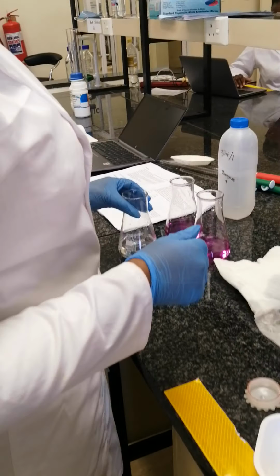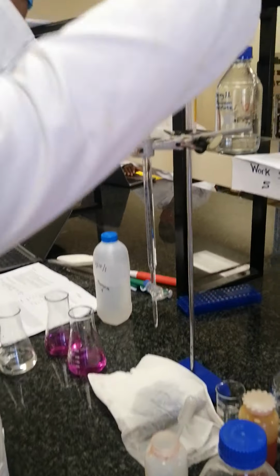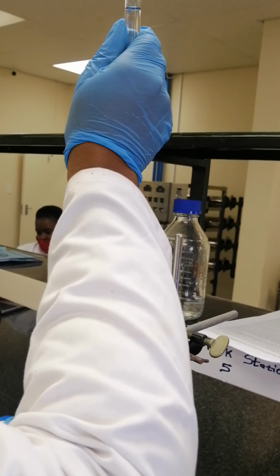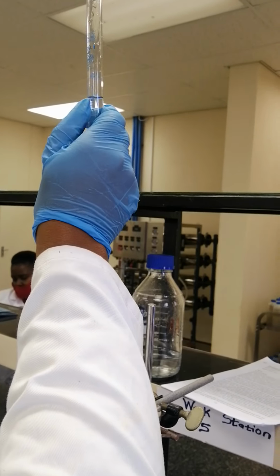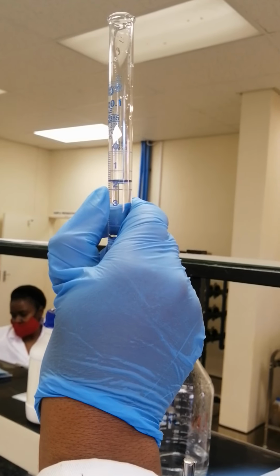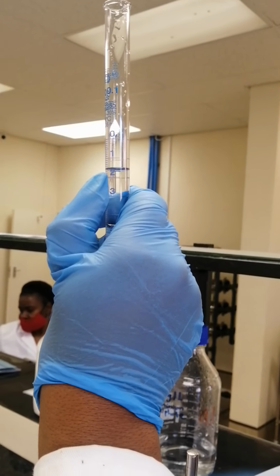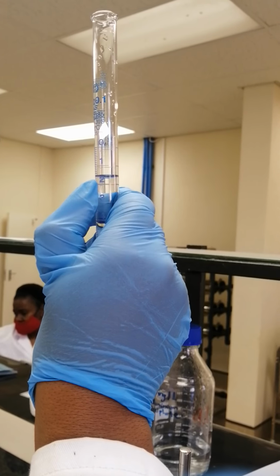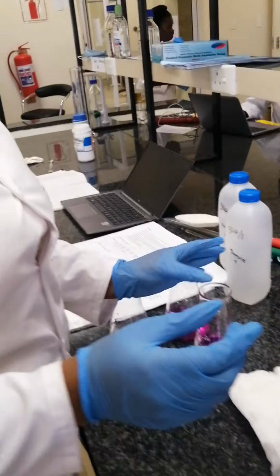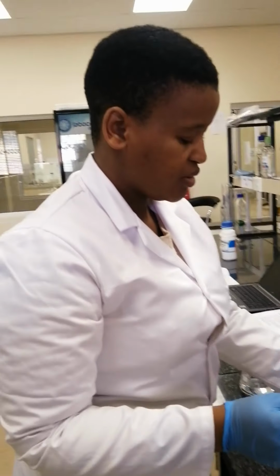After closing your burette, you can check the volume that you used to titrate your water sample. As you can see, this sample was titrated with 1.6 mL of sulfuric acid. Therefore, that's when you continue with your second flask.